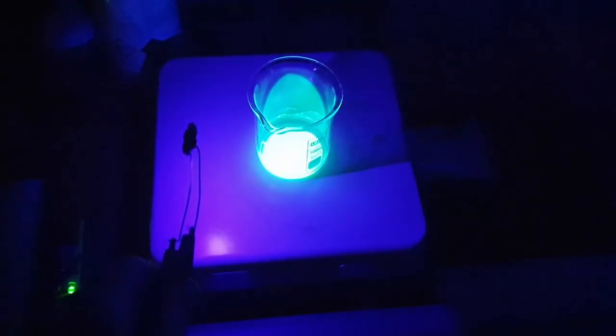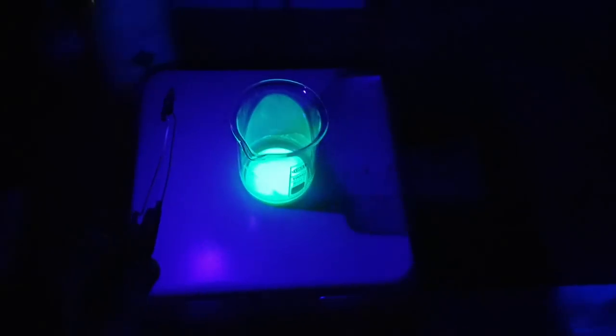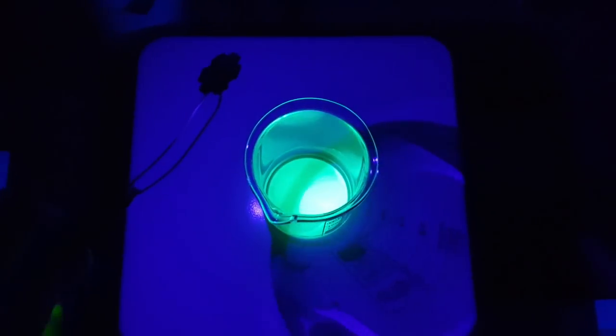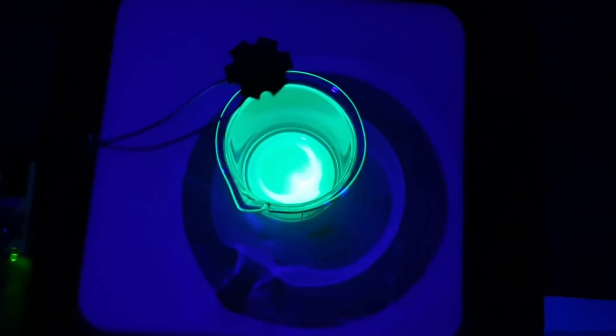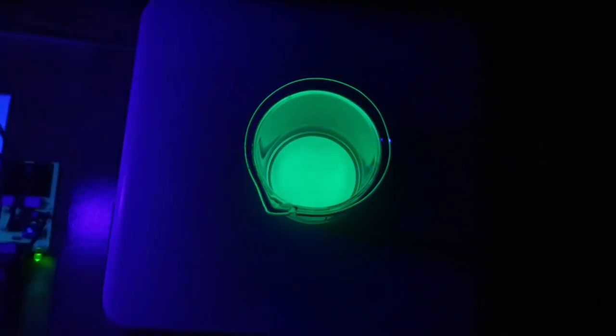After firing let the phosphor cool and wash it with water to remove flux residues. This is the result. I'm shining UV light to the phosphor and it emits a bright green glow.